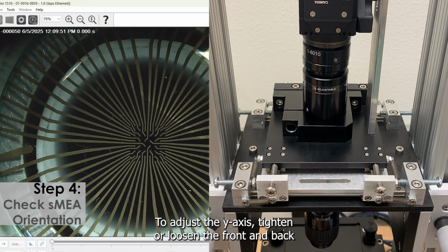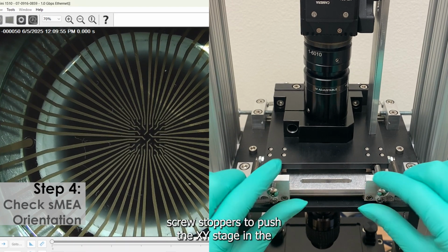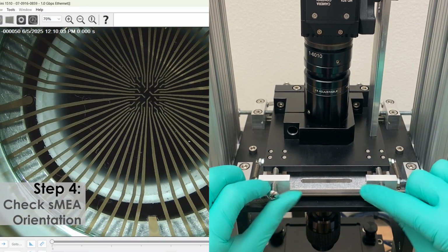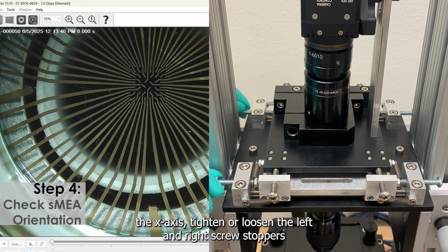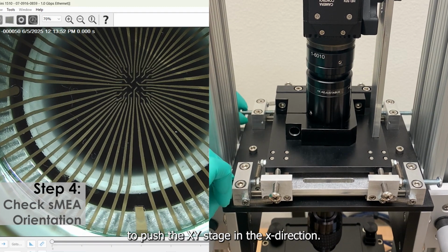To adjust the Y axis, tighten or loosen the front and back screw stoppers to push the XY stage in the Y direction. To adjust the X-axis, tighten or loosen the left and right screw stoppers to push the XY stage in the X direction.